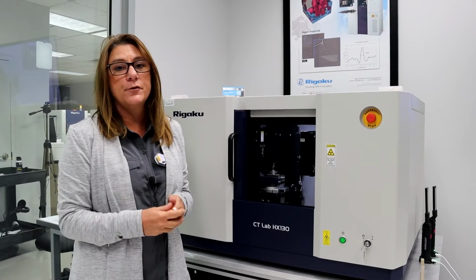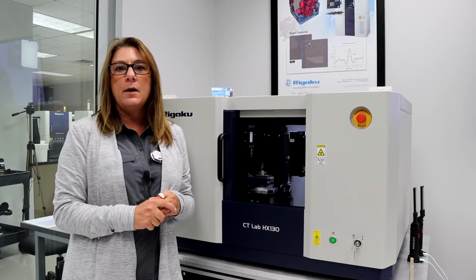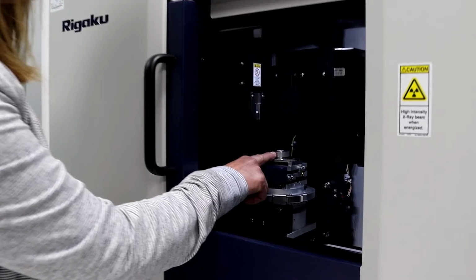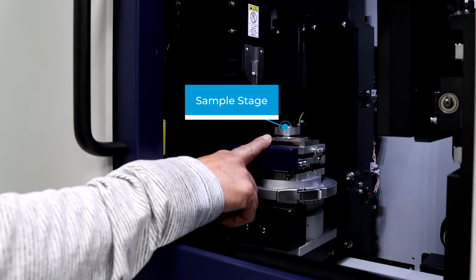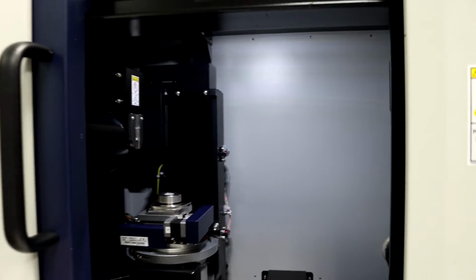You might also choose a filter based on your sample type. So let's say we were imaging a battery. You might want to use a thicker copper filter. This is where the sample stage is, so it has rotation and some translation. Downstream of the sample position, we have the area detector, and that's where the X-ray photons will be measured.